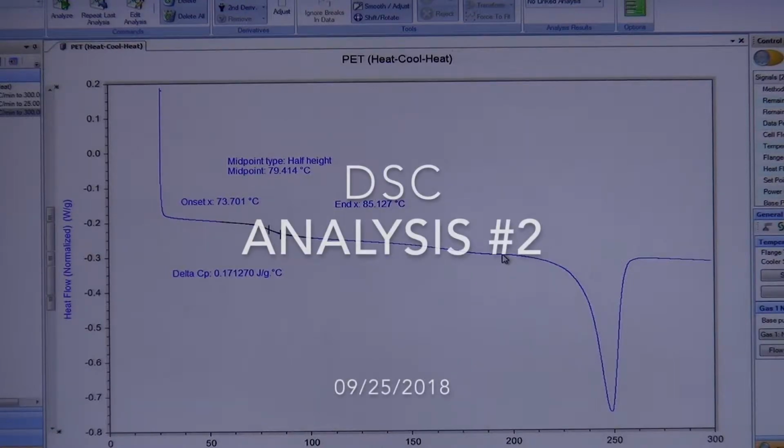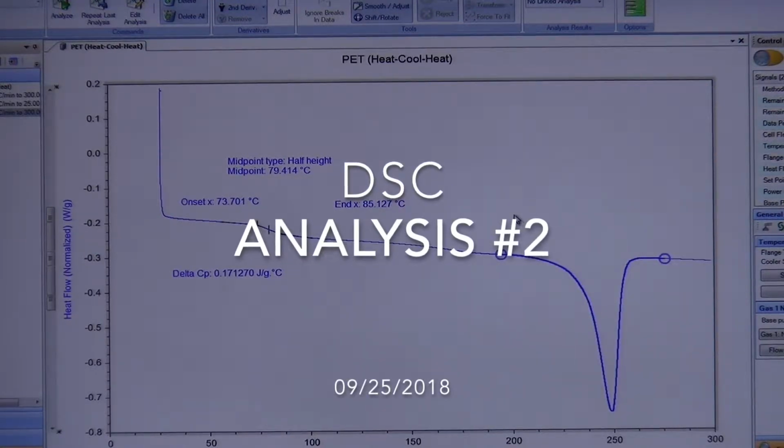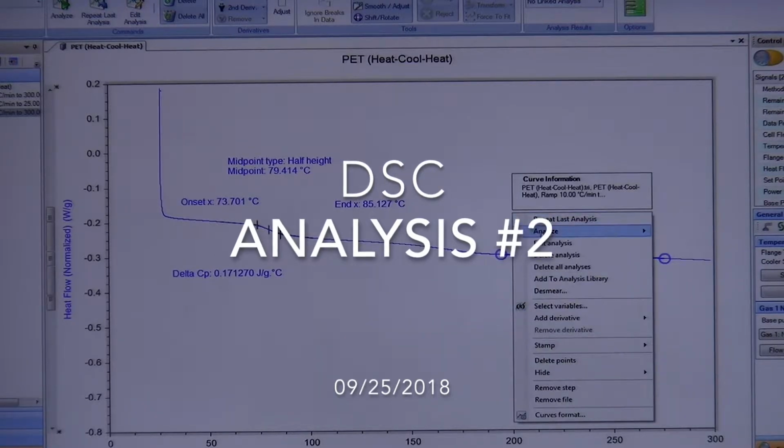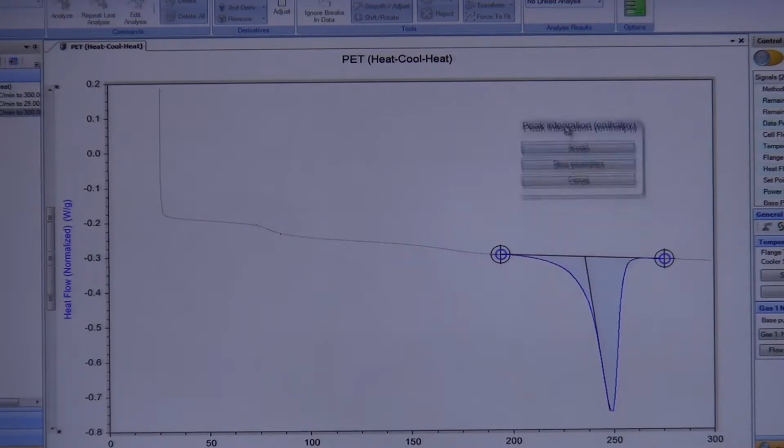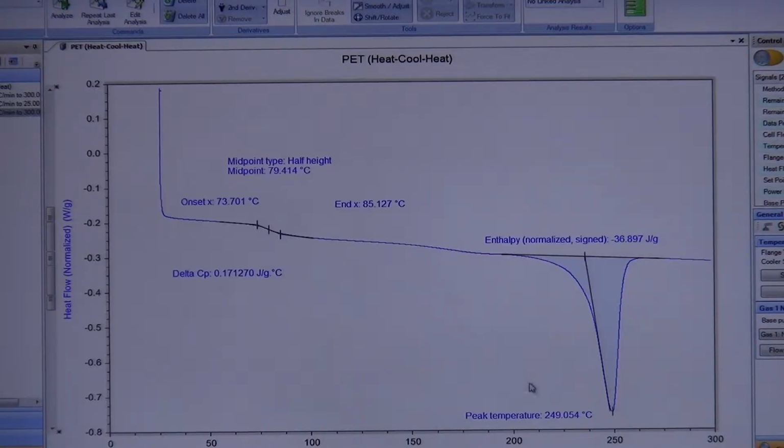Quick look, I would probably say maybe my melting is about that much. Okay? And a lot of people would probably agree with me. And you go to do your integration, you hit accept. Now you have your enthalpy is about 37 joules per gram. Okay?